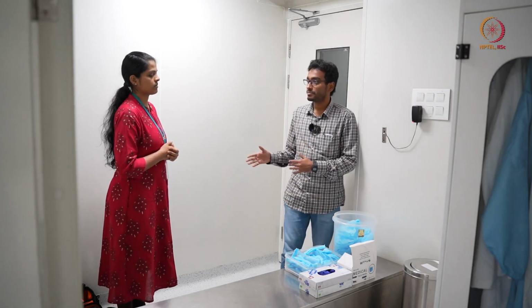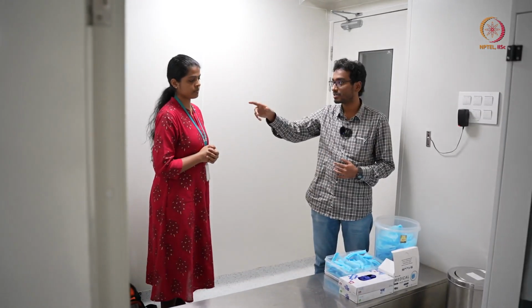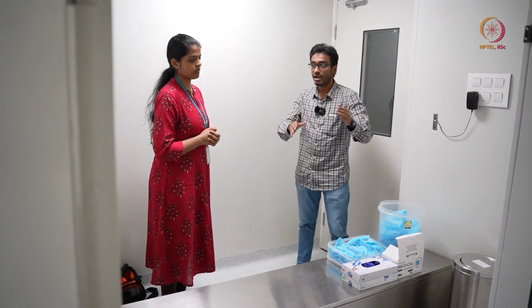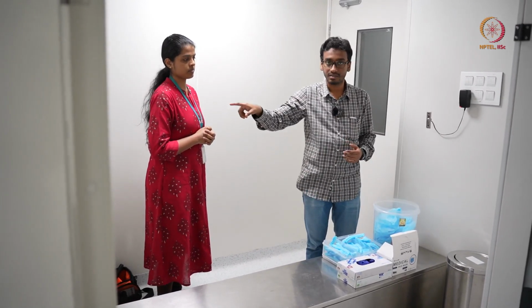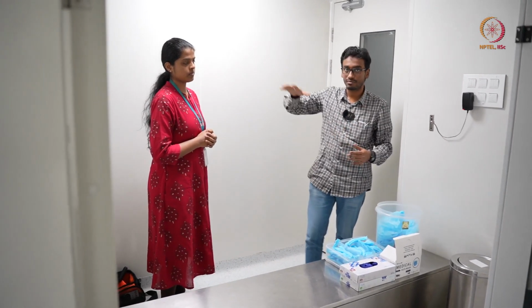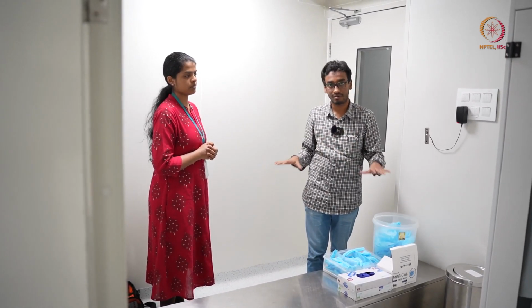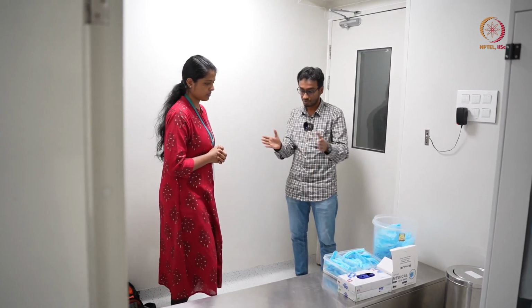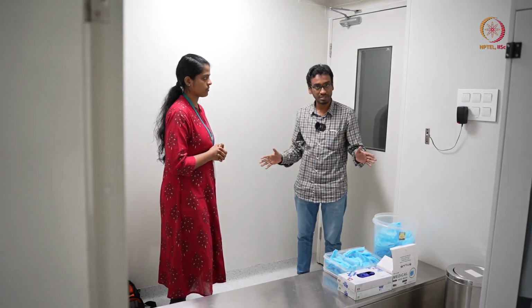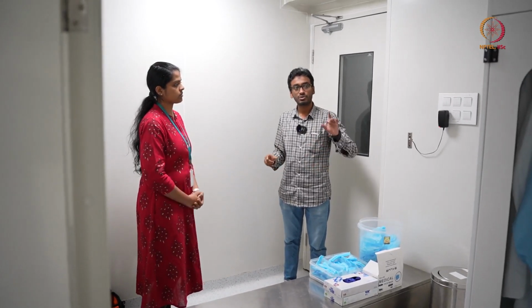My colleague Haripriya already kept her desiccator in the pass-through chamber we have shown earlier. So now she has to go in and collect the desiccator from inside, because you cannot carry something directly and go like that. Inside there is some airflow, so the dust particle count will be minimized. Now she will show how to wear all these PPEs, the gowning procedure, and in the process we will discuss what to do and what not to do during gowning and while going inside the clean room.